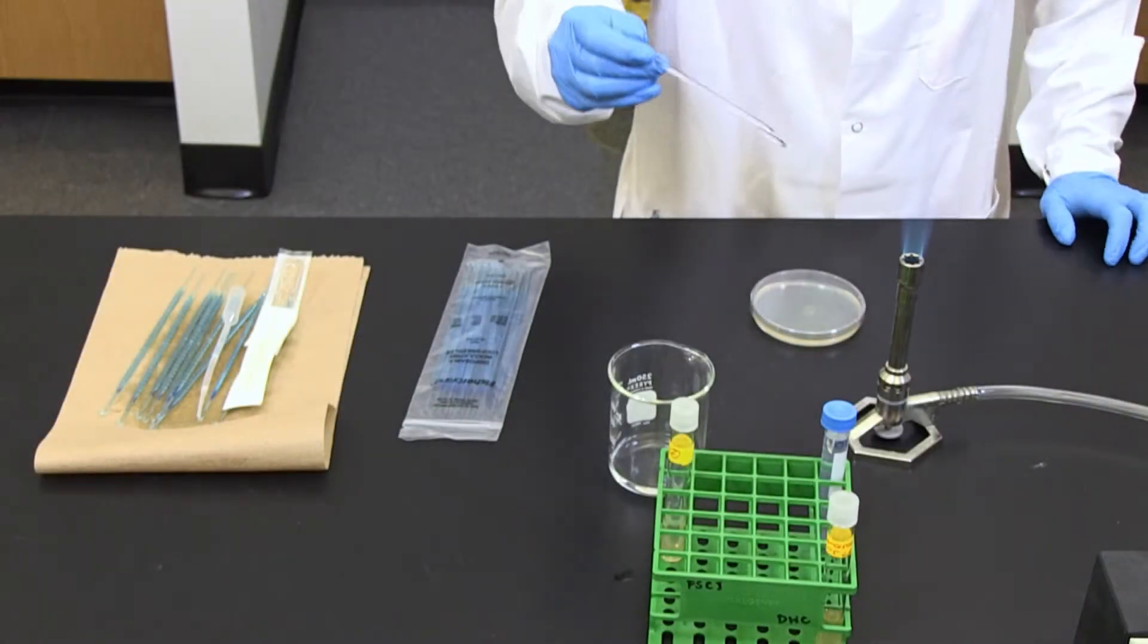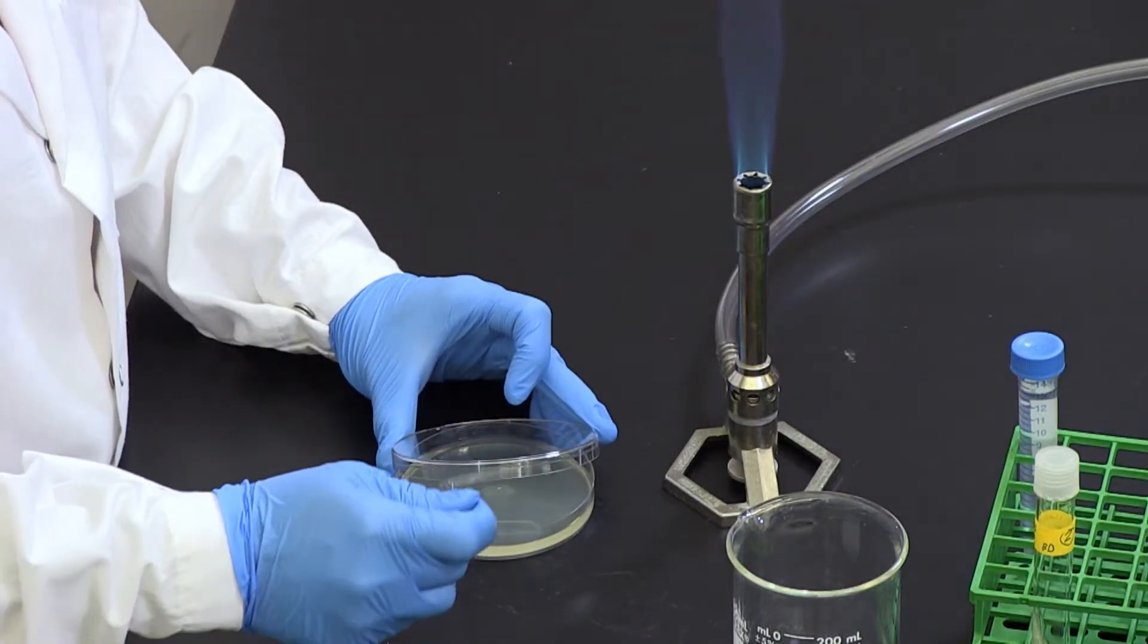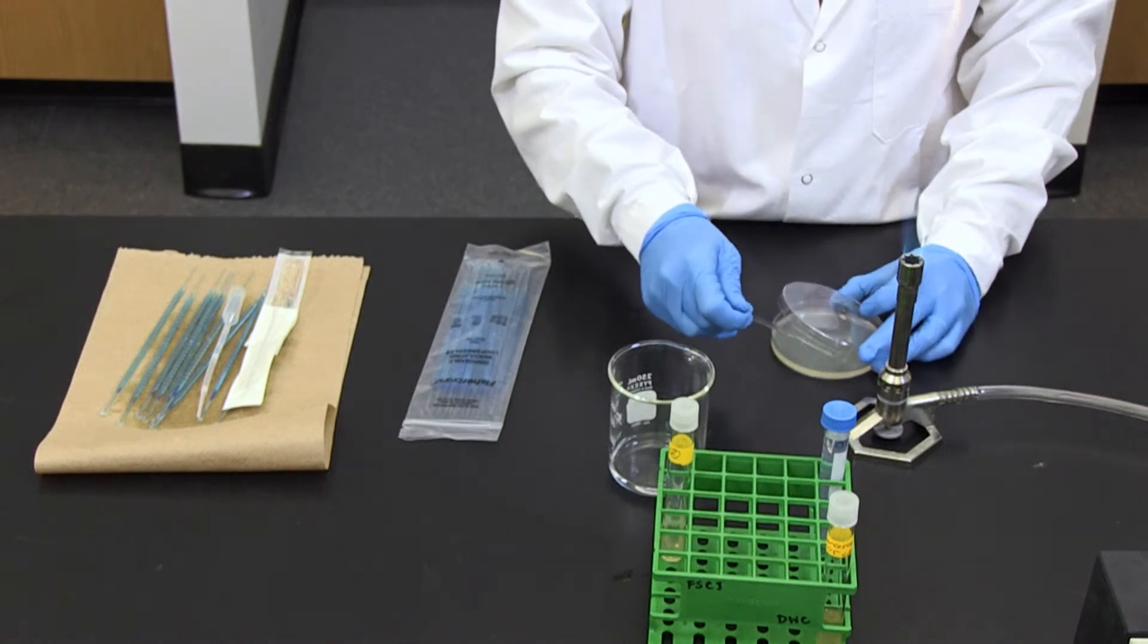Fourth, lift the lid of the agar plate at a 45 degree angle and hold it over the base as a shield to prevent airborne contaminants.